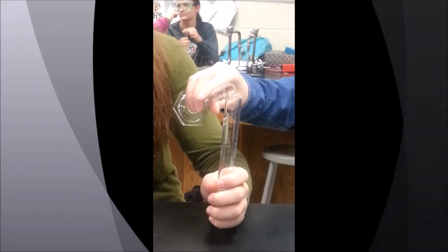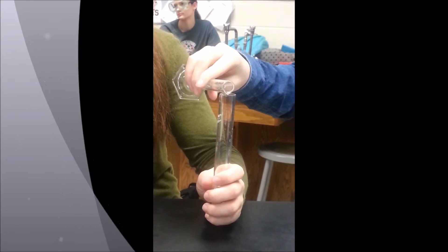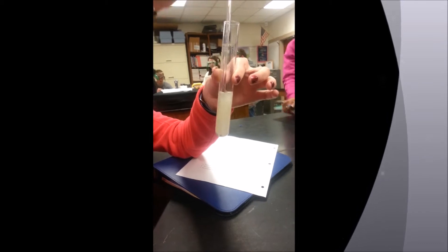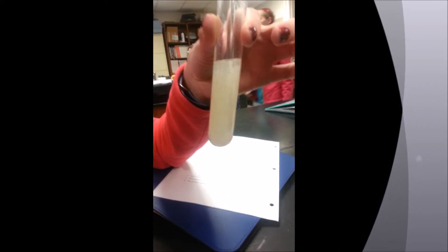After the crystals have dissolved, add seven milliliters of sodium hydroxide. Stir until crystals reform. Record your data and observations.